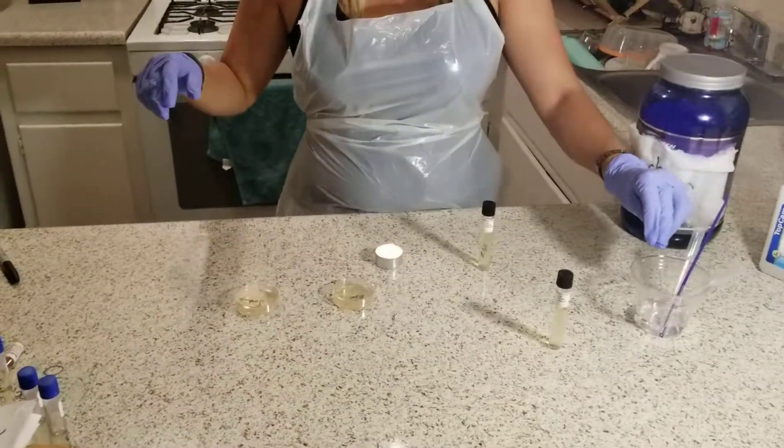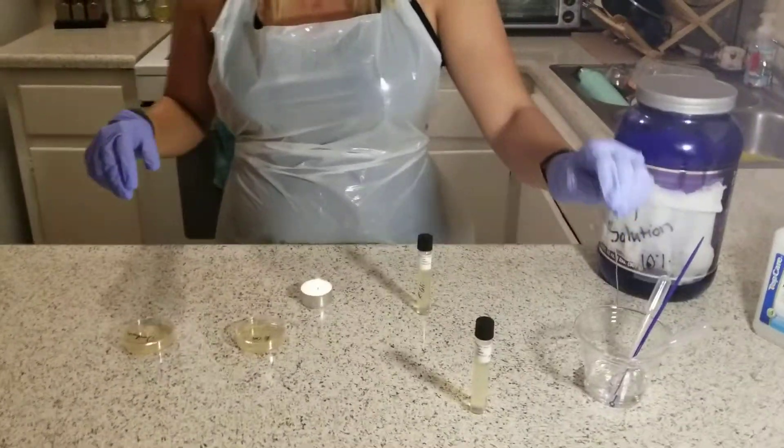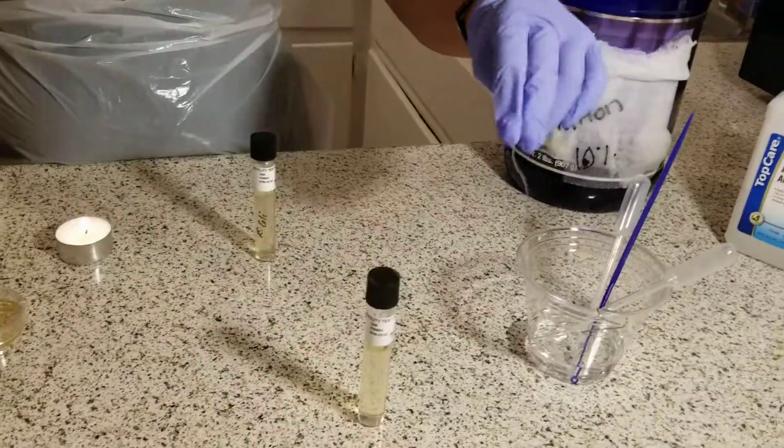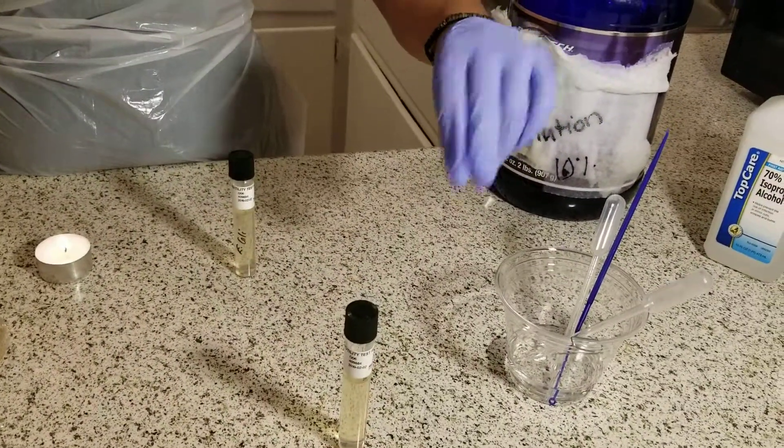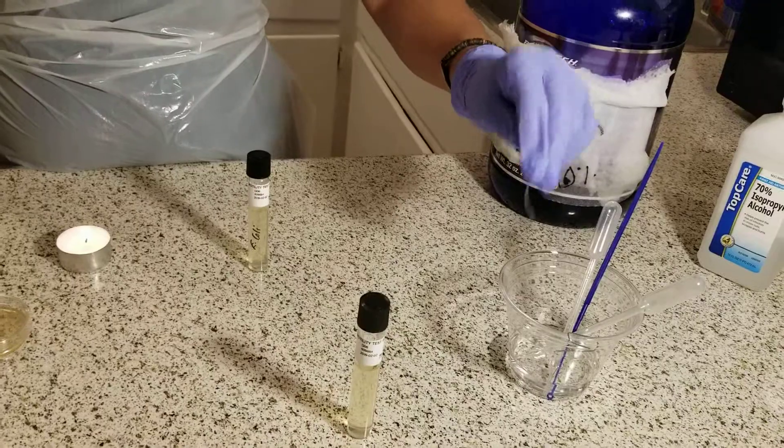First, I sterilize my paper clip in the alcohol, then shake it dry and make sure it's sterile.